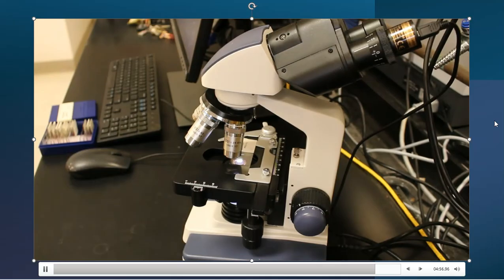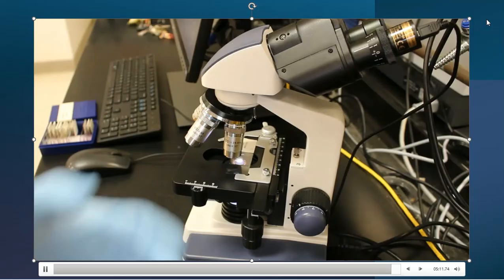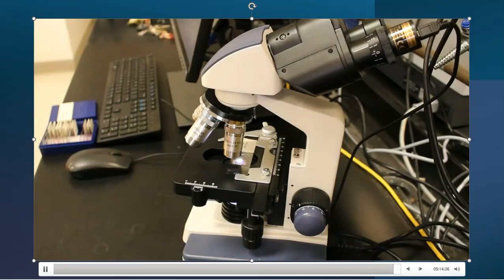So that's kind of an overview of the microscope. And here in a minute, I'm actually going to line up a slide for you, so that way you can see what to do when you come into the lab. And again, you maybe can do a few at a time and come in and out off and on, but that's up to you and your schedule. But we'll go through at least one motion of a sample.